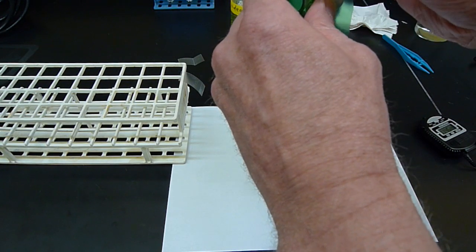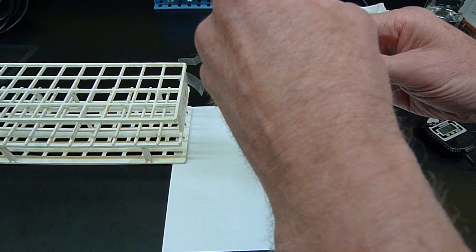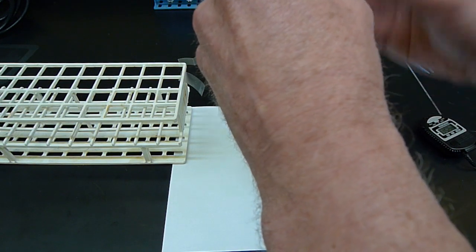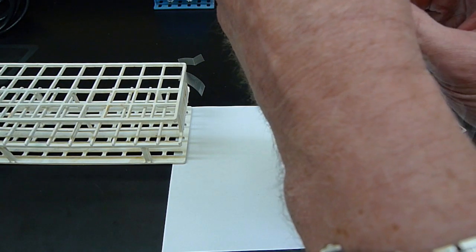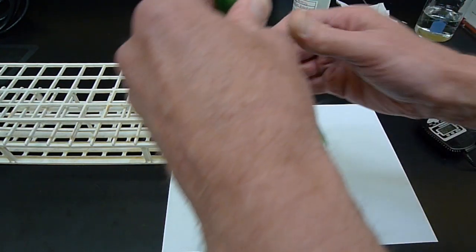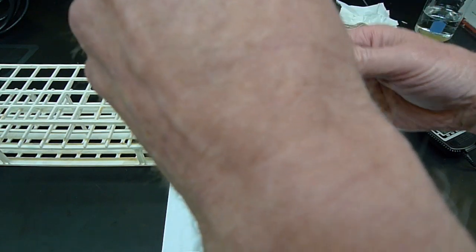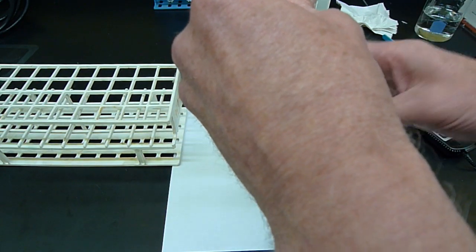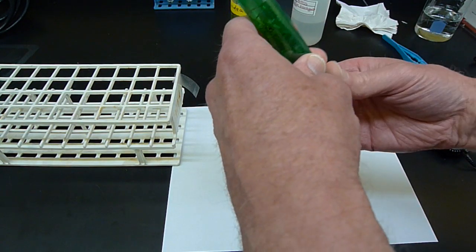That means that any light that the Elodea is going to be exposed to is going to be green rather than the white light. So why do we want to do green? The point is the photosynthesis is not sensitive uniformly to all the different colors of light. Plants look green. Why do they look green? Let me get this taped.